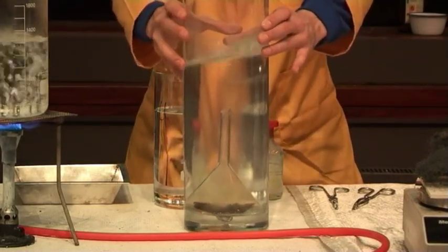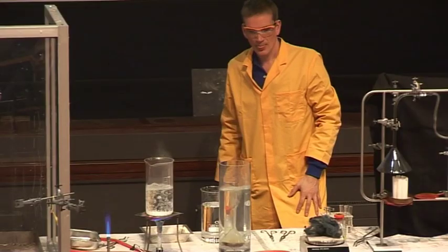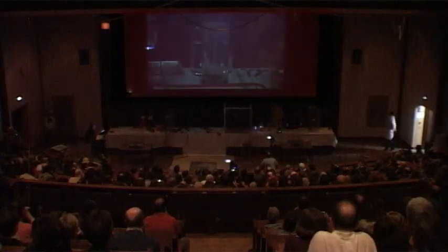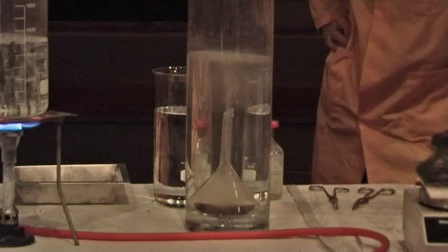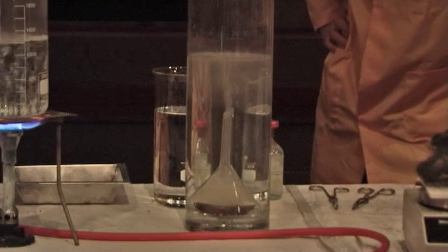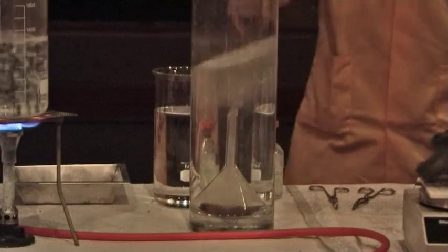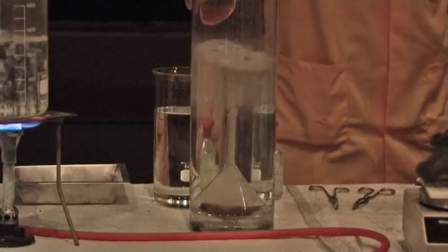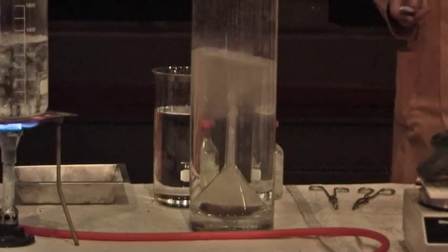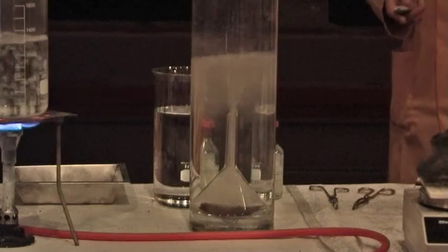Any second now, we should see some bubbles forming. And the bubbles, when they come into contact with the air, should catch fire all by themselves. That's it.